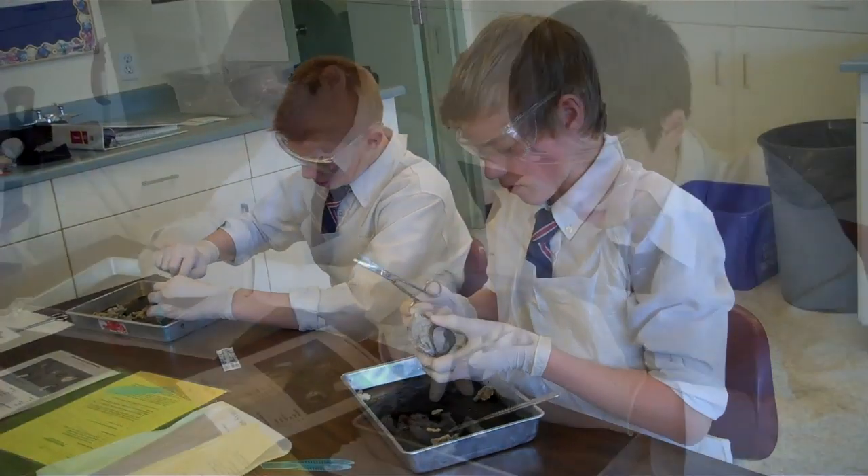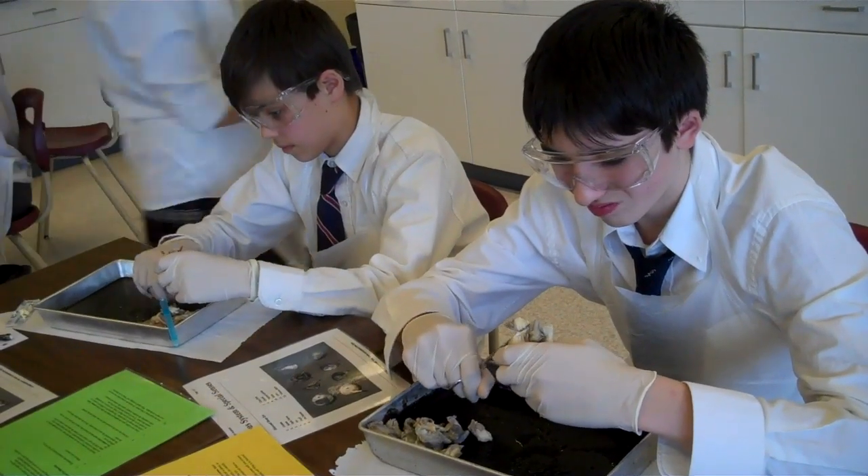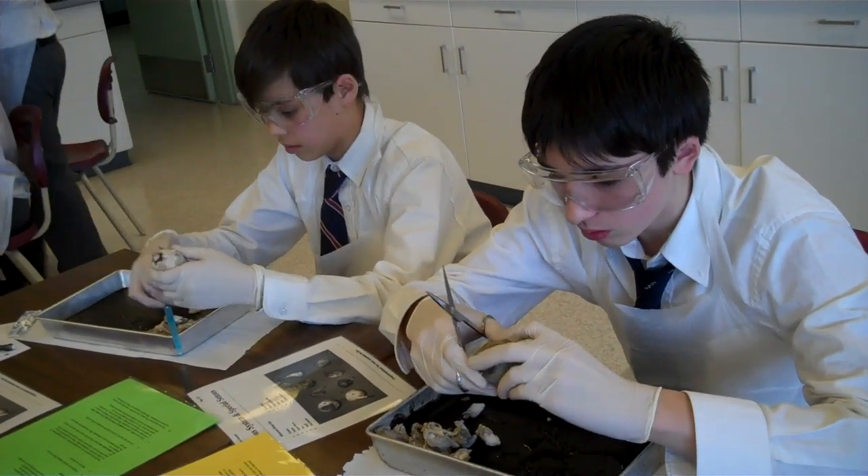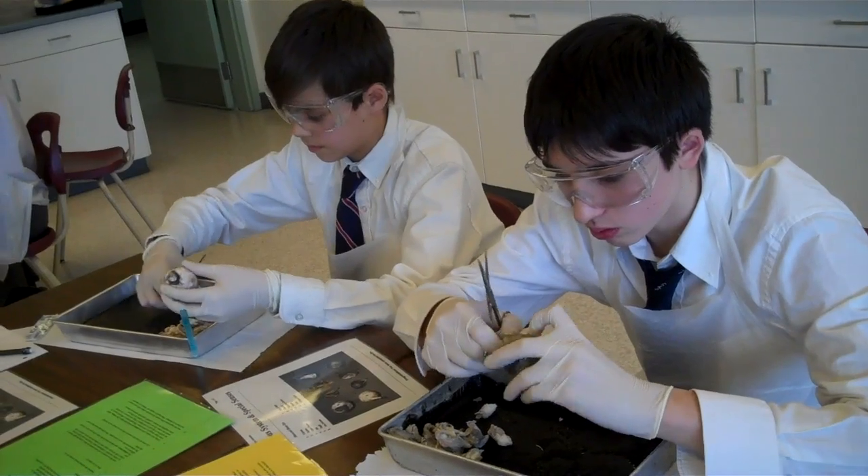You don't have to totally take it off. That's fabulous. Now, did you notice the oval pupil? You see how oval the pupil is on the cow eye?